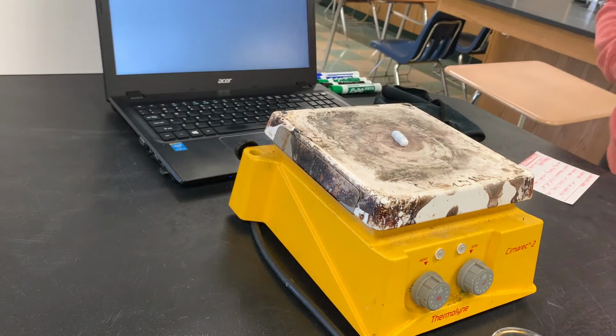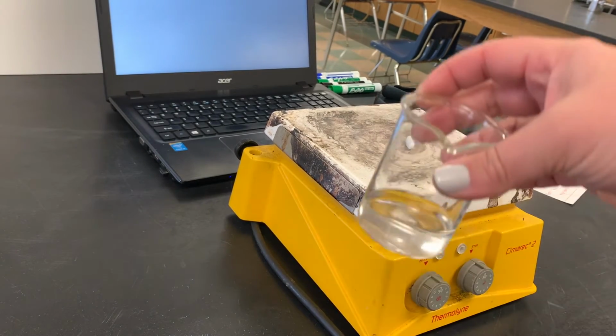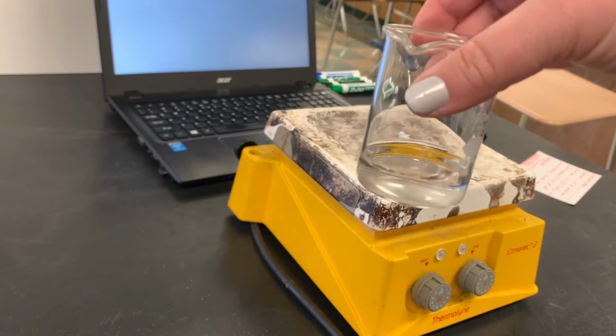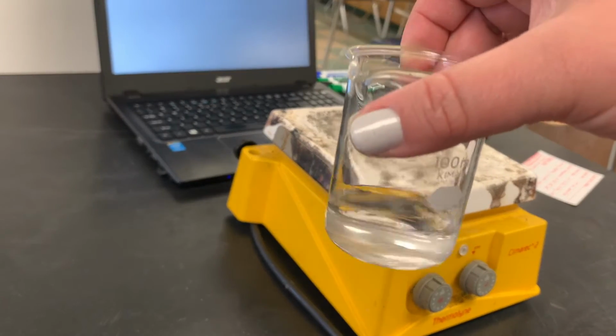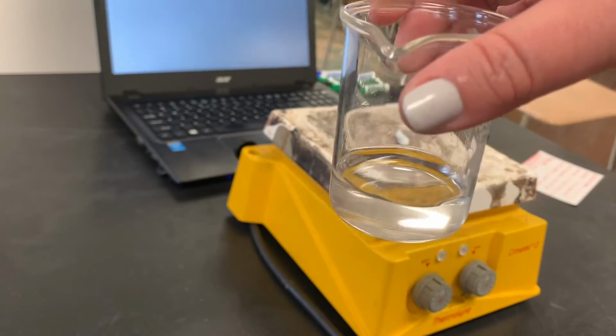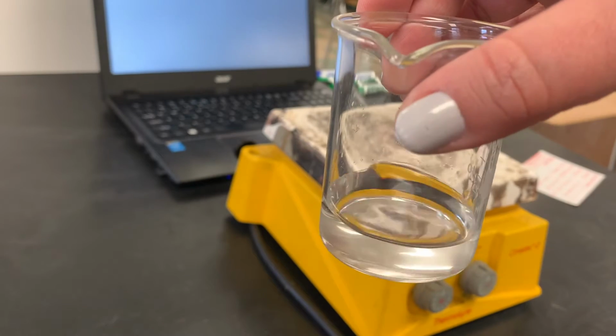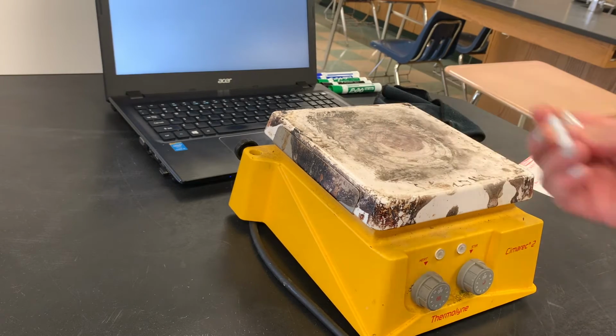a timer set up. What I've done is I've taken my 20 milliliters of water that I had in that graduated cylinder and I put it into a beaker. Beakers are really nice because they give us a little bit more room to work. We can see what's happening. We use them mostly like a cup. We're gonna hold things in them. So we don't use beakers to actually take a measurement, just to hold whatever reaction is taking place.